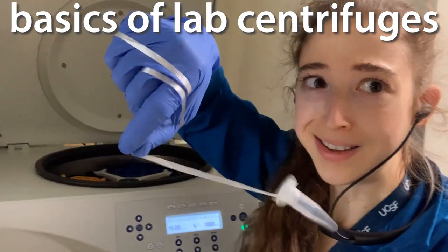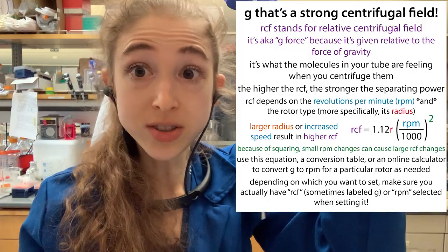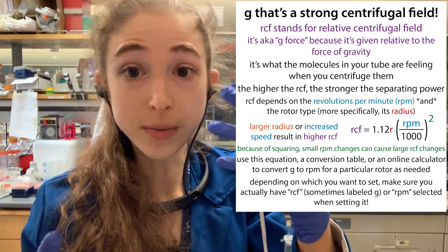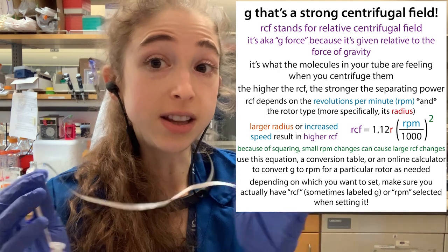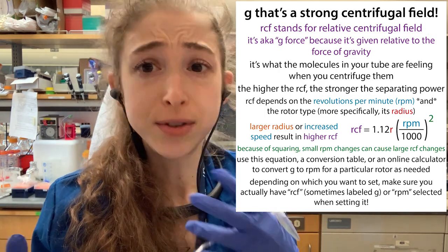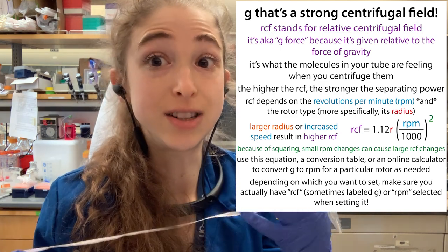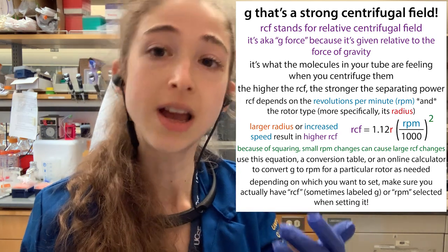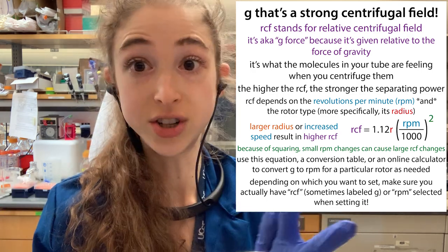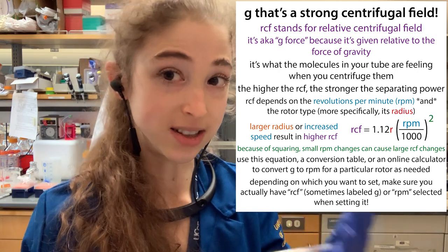Centrifuging can get kind of confusing, so here's a guide. The most confusing thing starting out — something you want to make sure you have set correctly on your machine when you're setting things up — is whether you're dealing with RPM, revolutions per minute, or RCF, the relative centrifugal field.